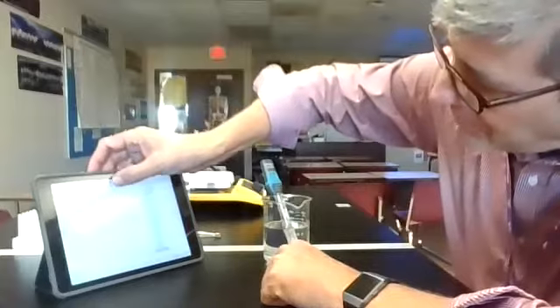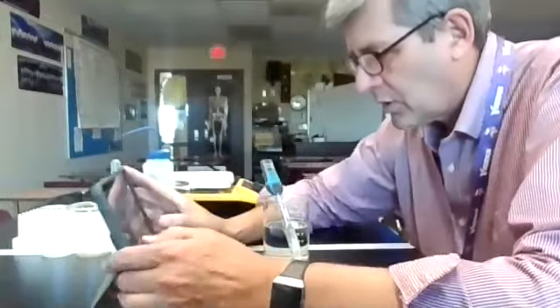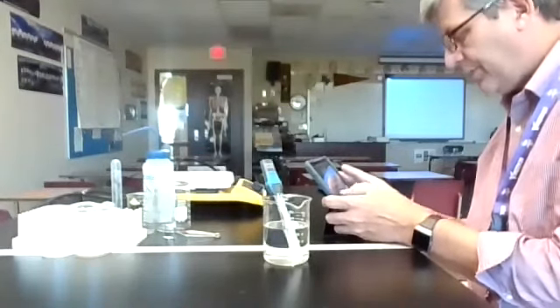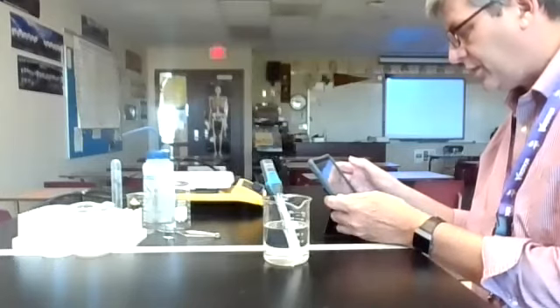I'm going to hit stop, and there is our file. I'm going to save the file. You just got to type it in here. PDB Lab. And this is the file that I am going to send to you guys.